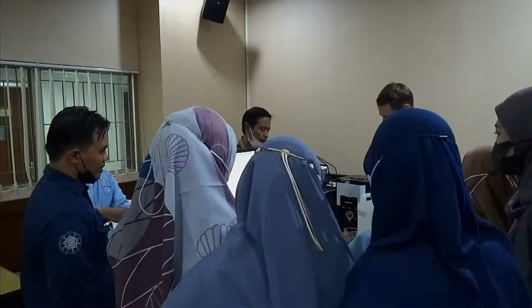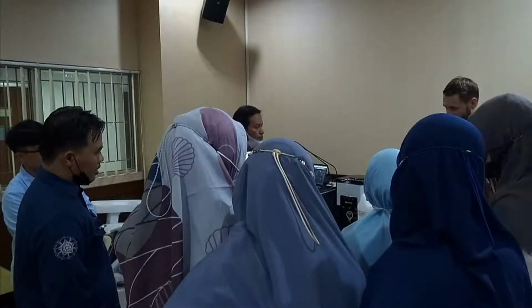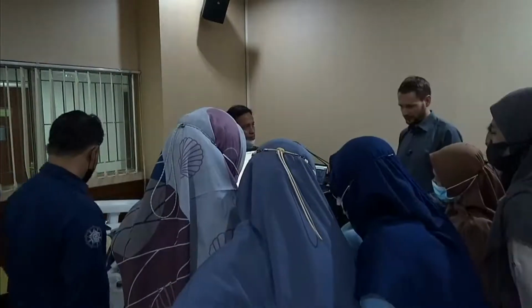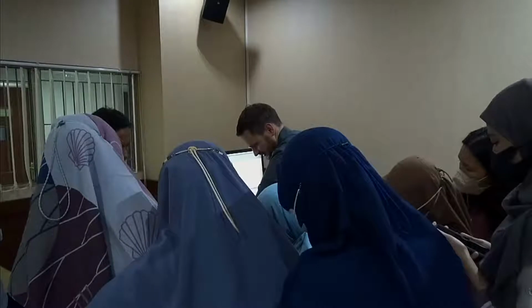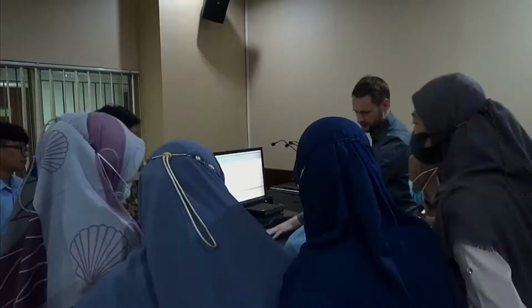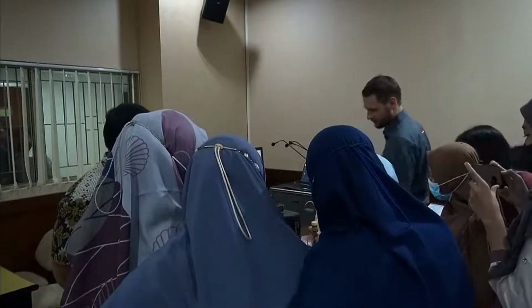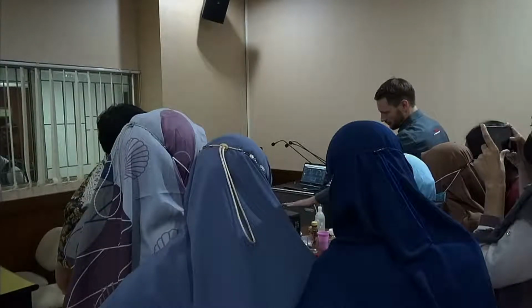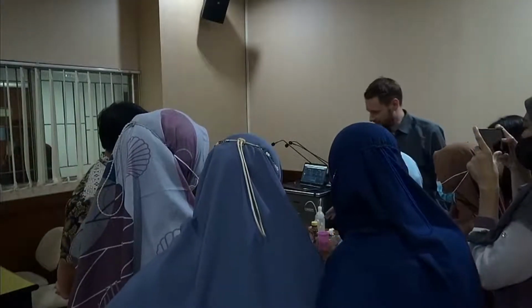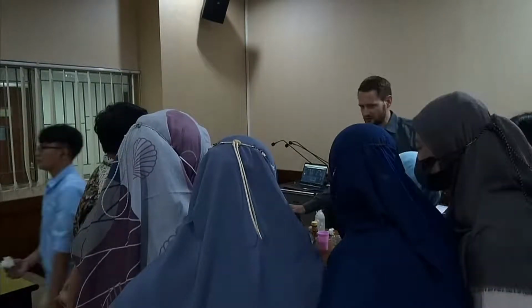So, again, I start with the hardware. Basically, what you see is the way it comes when it's delivered. In our case, we also have the ultrasonic box. This is the silver box right here, which is just attached to the wet dispersion unit. If you don't need ultrasonic, you can also just leave it out of the cycle and just use the wet dispersion unit. Apart from that, you see monitor, computer, mouse, keyboard, everything comes plug and play, so the software is pre-installed, and that way you can just connect everything and you're ready to go.